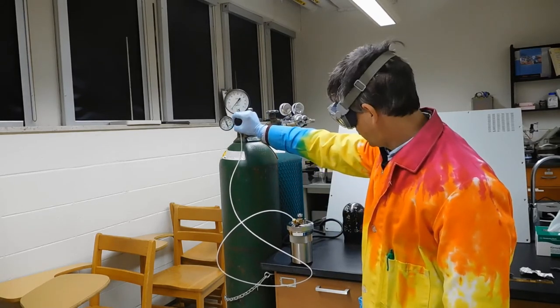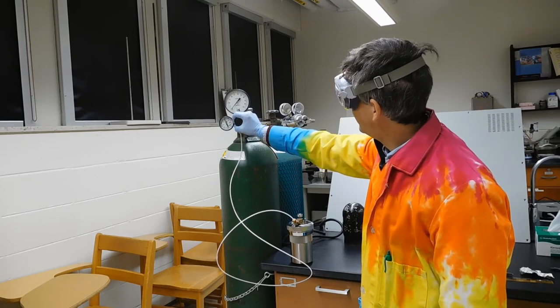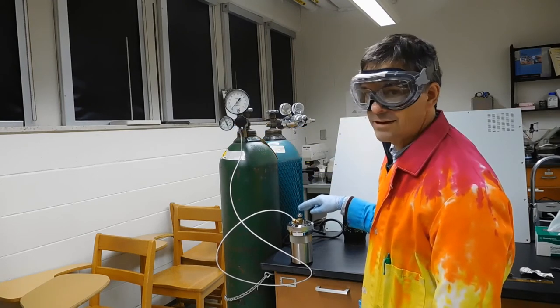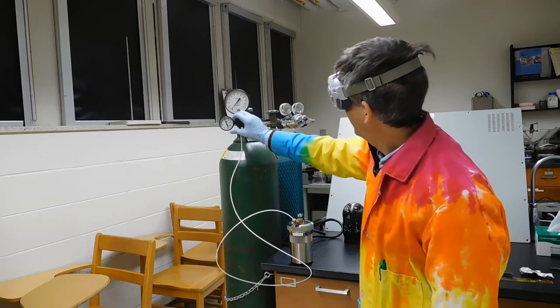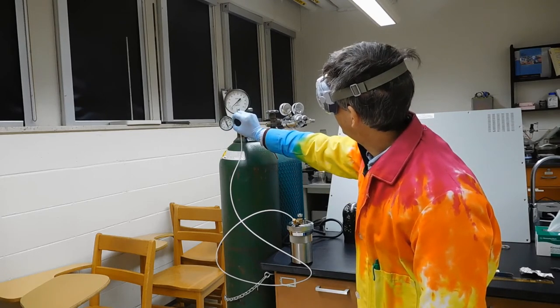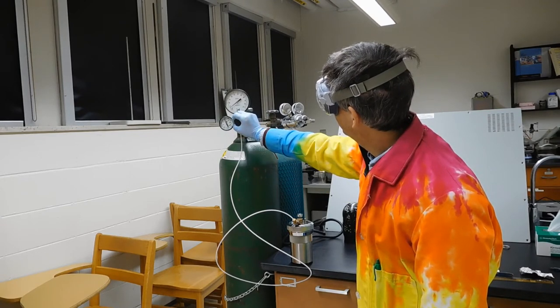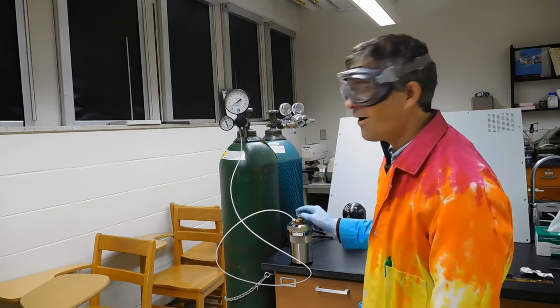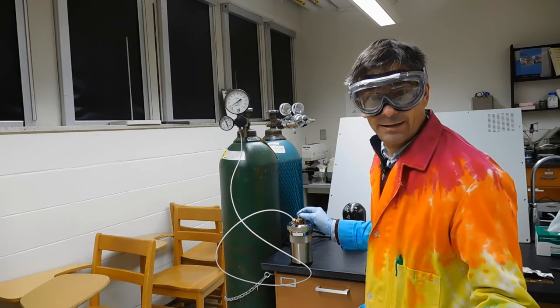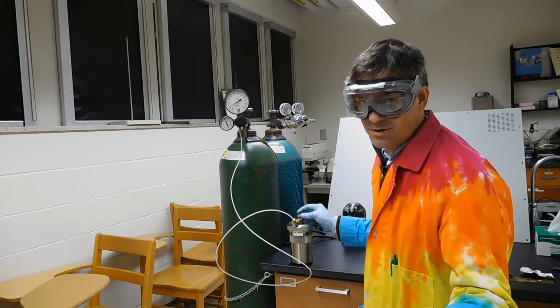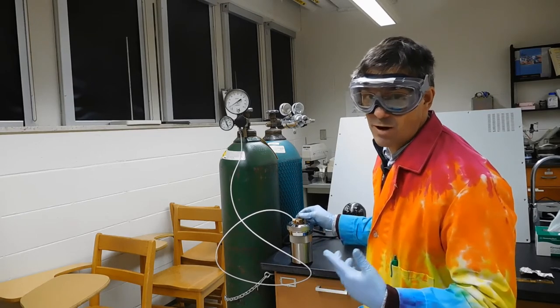Then you just gently turn this on, and if things are set up right, you'll hear gas coming out here. If you turn it up so that it's reading about four to five atmospheres, that's a good flow. Now I have to talk at you for a minute and tell you more about this because this has to run for about a minute.